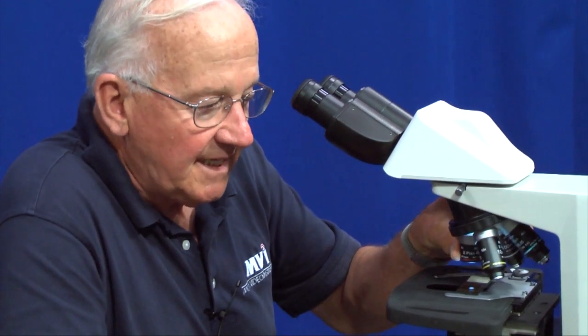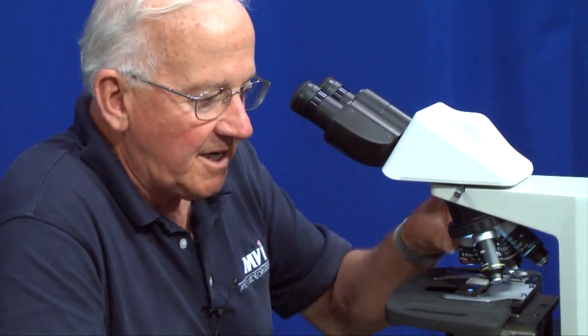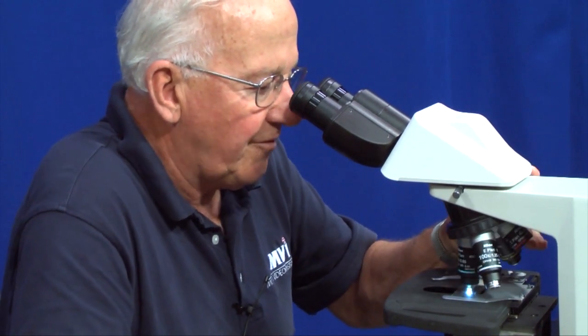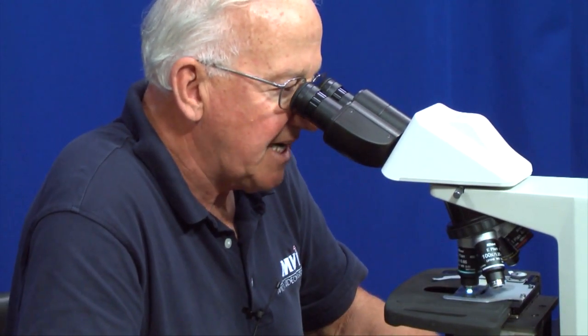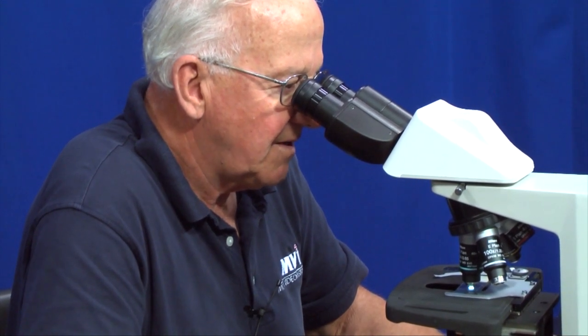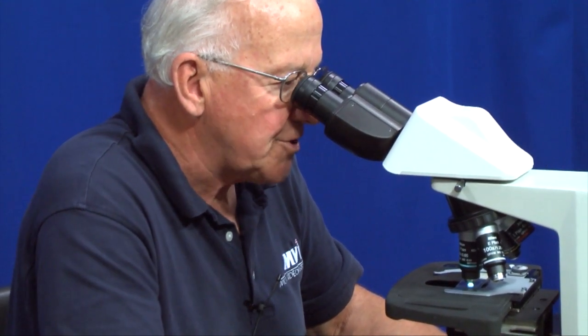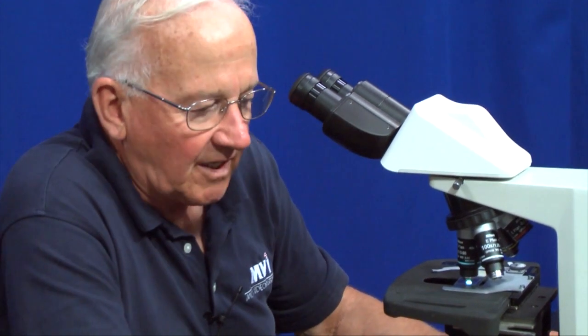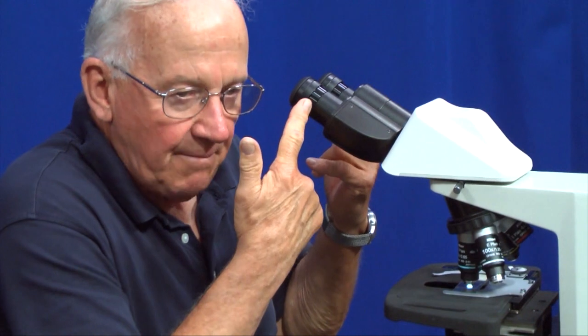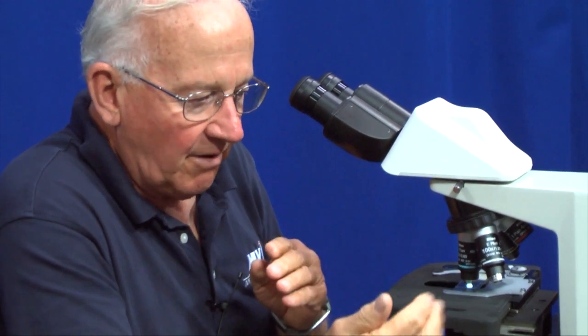That means that when you go from one objective to the other, the objectives will be parfocal, which means they'll be in focus. With the 4x objective, I go up to the 10x objective, I don't have to refocus. I go to the 40x objective, I just have to touch it to bring it perfectly in focus. Modern day microscopes are almost perfectly parfocal. When you go from one objective to another, if you have set the microscope up properly, they will be perfectly in focus.